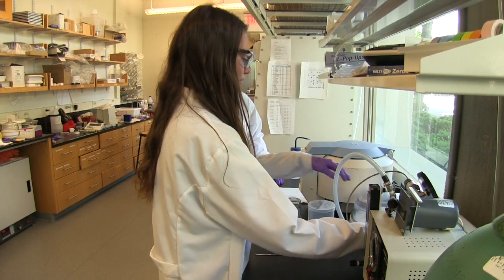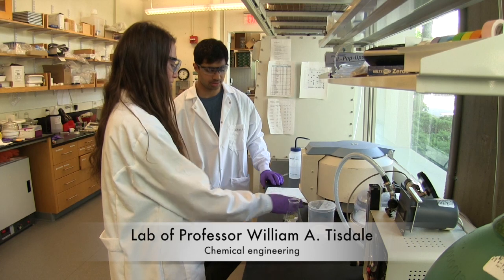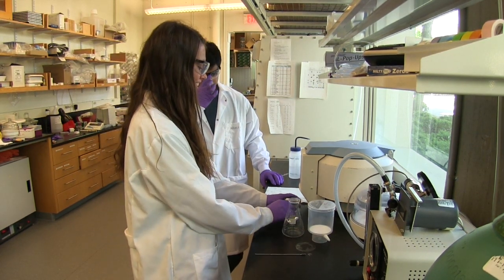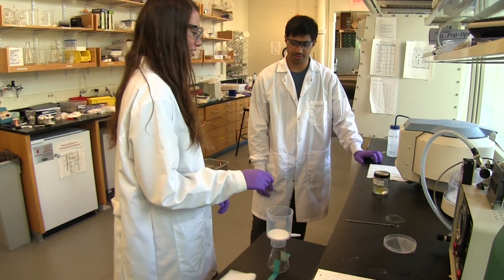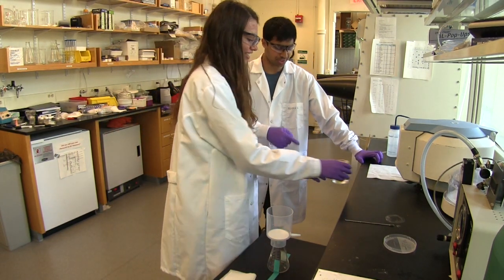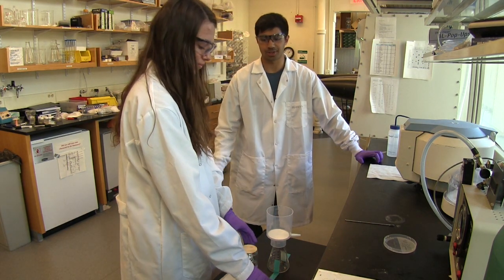So, what are you going to do, Grace? I was going to take the solvent off of these crystals. Yeah, dry them out. I'm going to dry off these crystals. Is it okay if I use that vacuum? Yeah, that's okay, as long as you set up the trap. Otherwise, the solvent vapors will get in the pump, and that's dangerous.